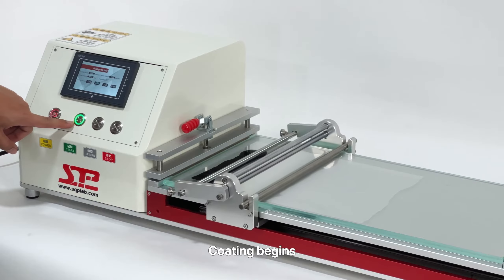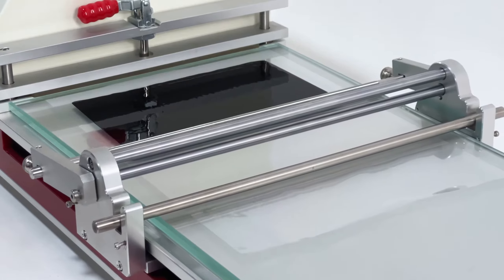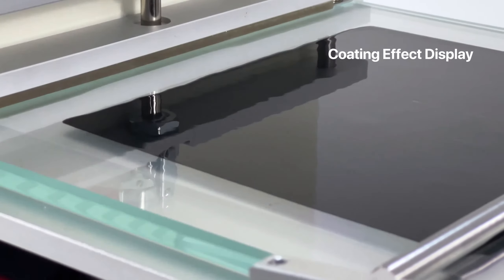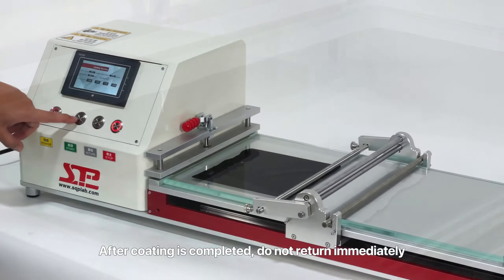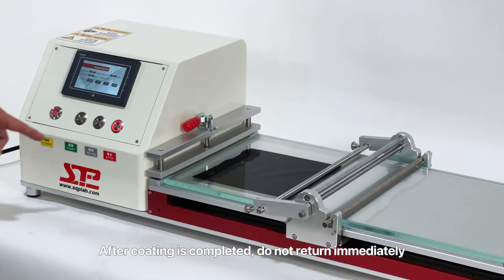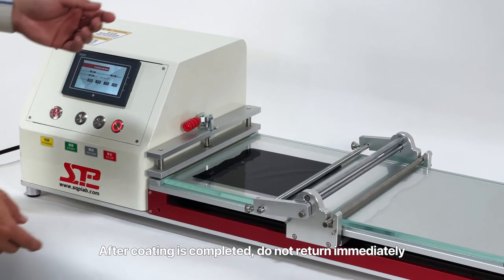Coating begins. After coating is completed, do not return immediately. Pick up the wire rod and roller first, and then press return to avoid damaging the coating.